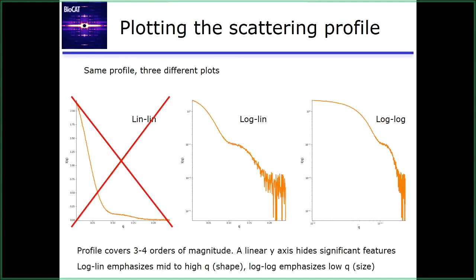You essentially never want to use a lin-lin plot. I don't want to see this. And the reason is that your scattering profile, if you look at this log-lin plot, is covering three or four orders of magnitude in your measurement. So when you put a linear y-scale here, you're hiding a huge amount of information and variation in the profile that you can't see, and it can be extremely deceptive. So unless you have a particular purpose for putting it on this plot, I recommend you don't.